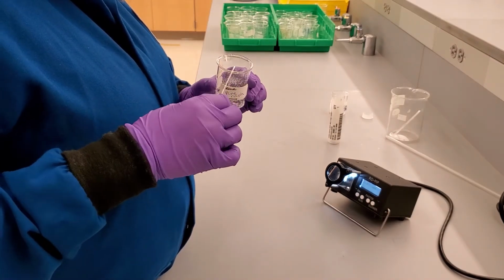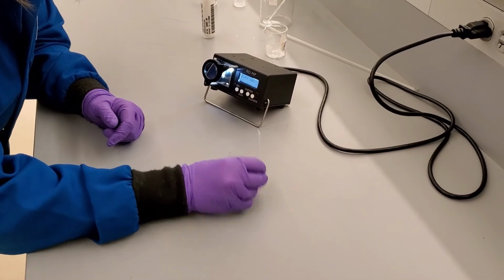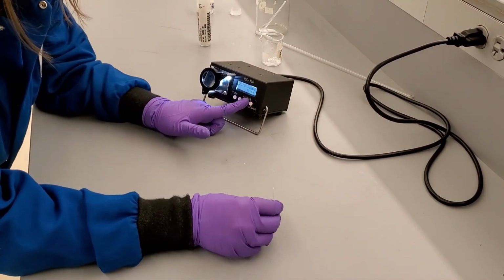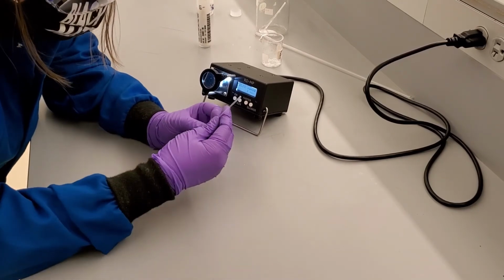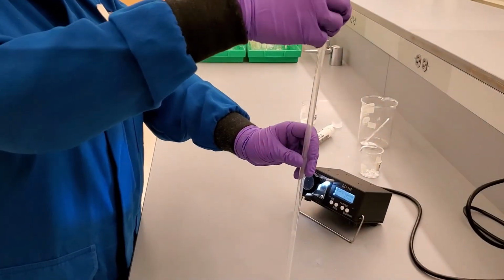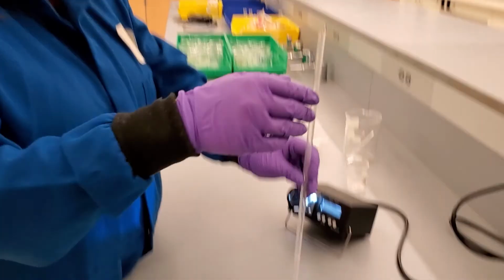It takes longer to get enough pure naphthalene in the capillary because pure naphthalene is in flaky sheets rather than a powder. Thinking that the glass tube is still staticky, we tap the tube carefully and firmly on the bench to get the naphthalene to fall to the bottom of the tube. As we tap the tube, we start the temperature ramping of the melt temp. Tapping is taking too long, so we try the glass tube, which is no longer staticky and allows the capillary to drop. We do this a few times until the naphthalene is at the bottom of the capillary.